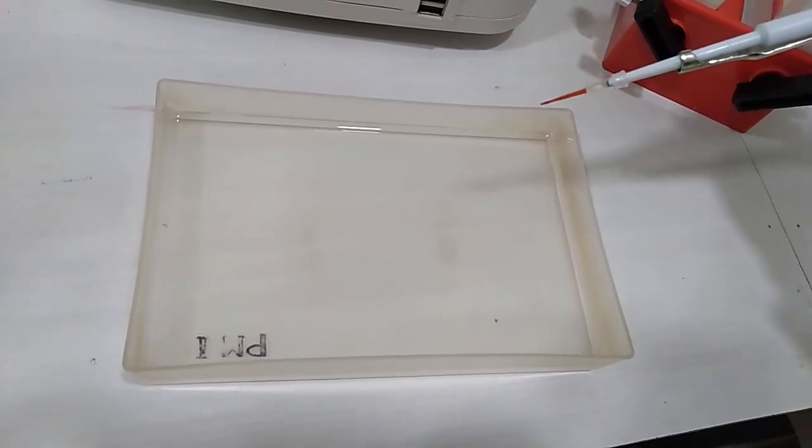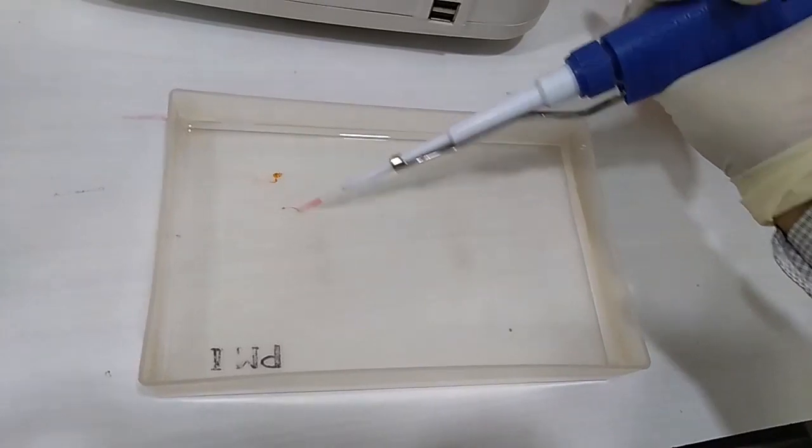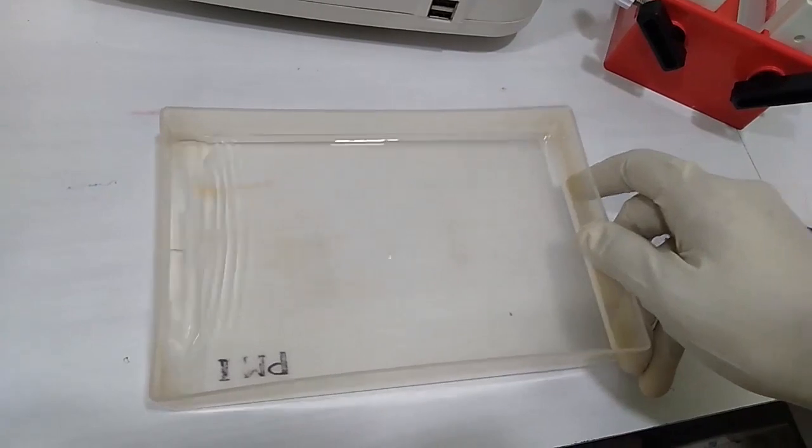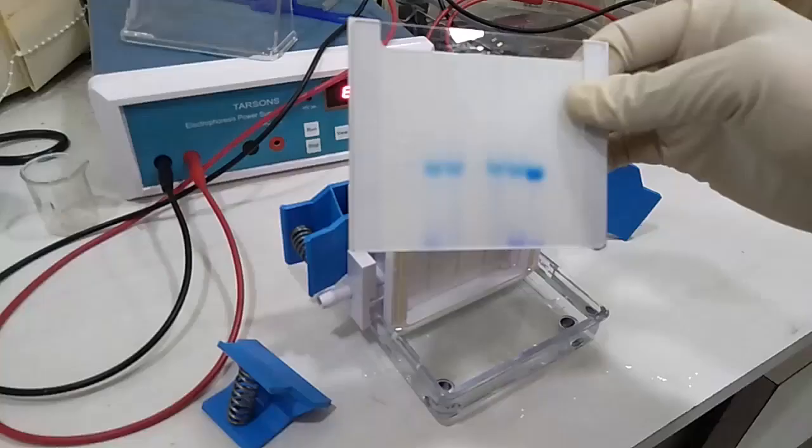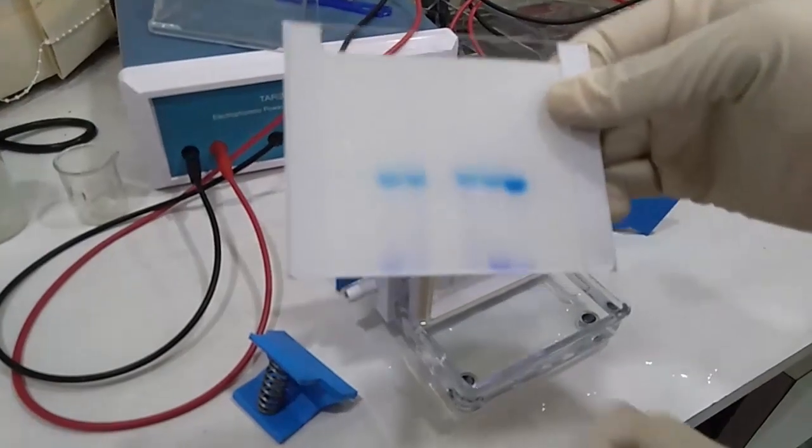I am now mixing ethidium bromide solution with the distilled water here. And we have to mix it carefully that it be homogenized. And the solution all become homogenized. So this is ready and now we need to open it.